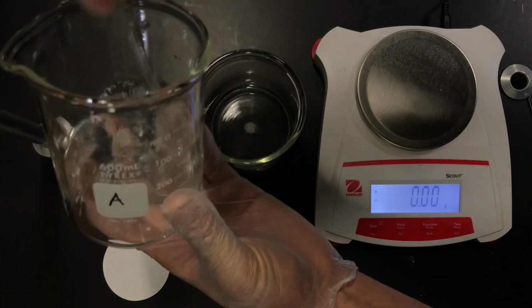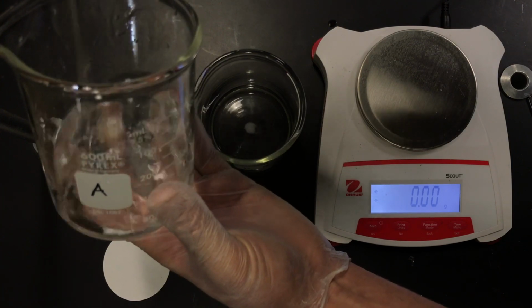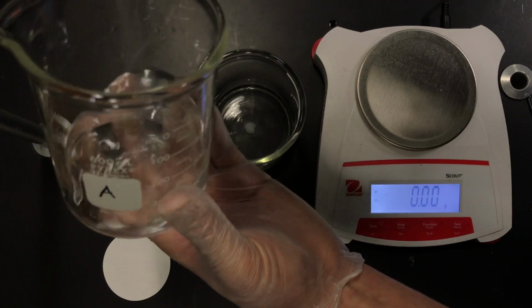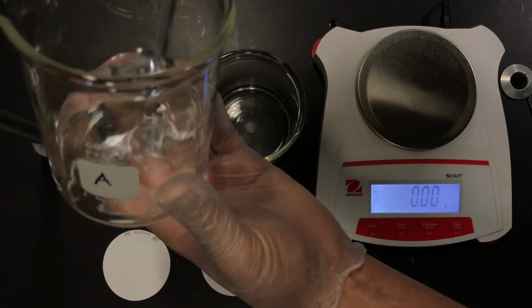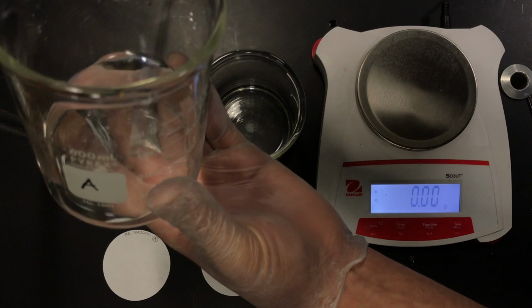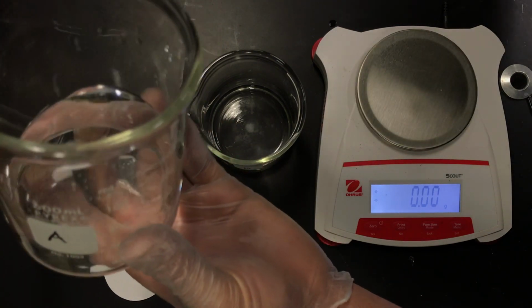It's important to dissolve all of those carbonate ions, because those carbonate ions are what we're after. And again, the amount of water is inconsequential here, because we have all the salt dissolved. We have the mass of the salt, and all of the salt, particularly those carbonate ions at -2 charge, is what we're after here in this precipitation analysis.